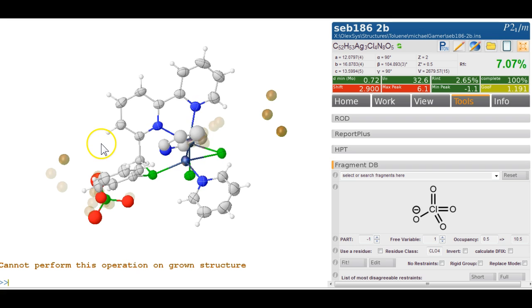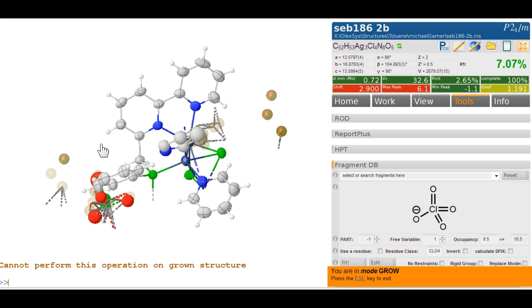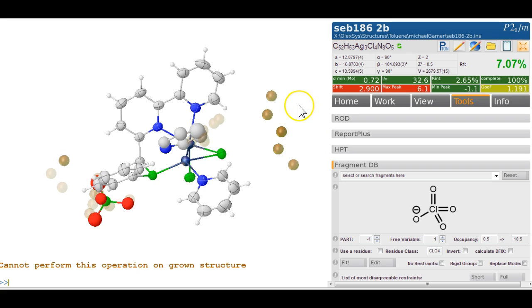So there's something here. Let's go Control G on this. Oh yes, it grows. And that peak here looks a bit bigger than the other. 6 and 3. Yeah, okay. So this is symmetry equivalent. So this is probably diethyl ether. So we just go shopping again and type ether. And there it is. So again, it's over the symmetry element with the oxygen in the center here, and we import it in the same way, -1 and 0.5.